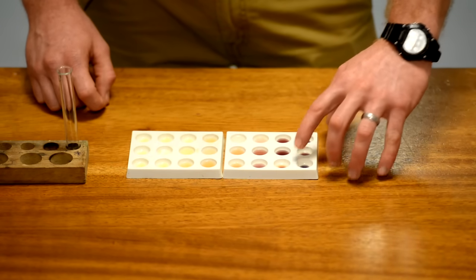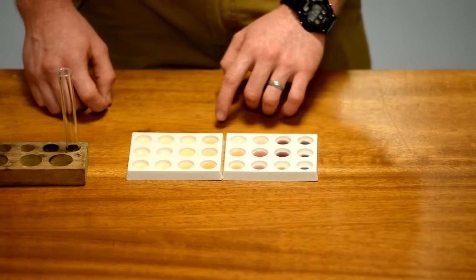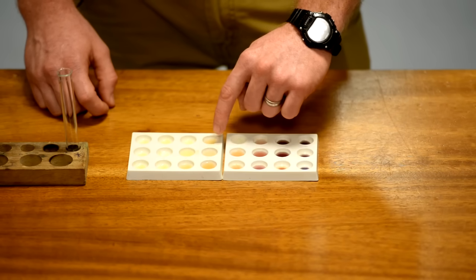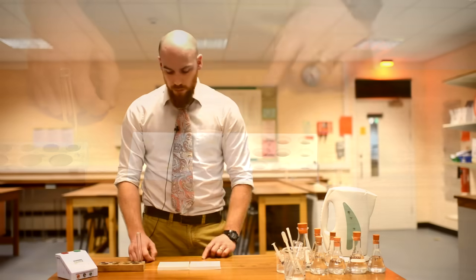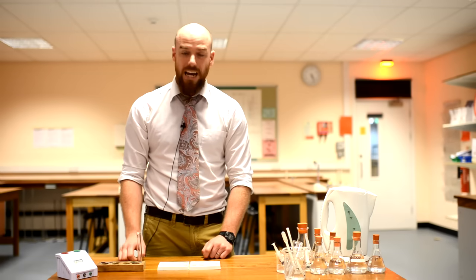So 10, 20, 30, 40, 50, 60... 120, 30, 40, 50, 60... 170 seconds for starch to be digested at pH of 5.